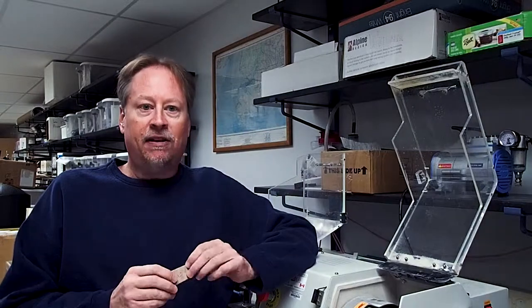Now that we've cut off the bulk of the rock chip from our slides, we are ready to initiate the final stage of the thin section making process, which is to grind away the remaining material on our slide to a thickness of 30 microns.